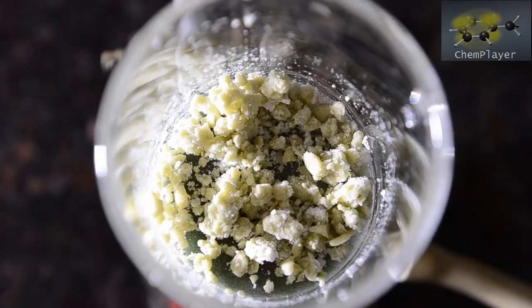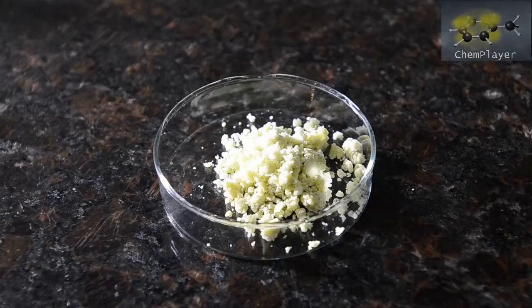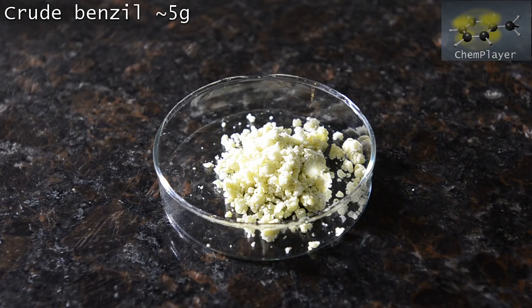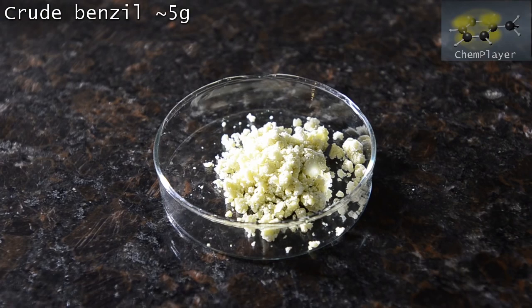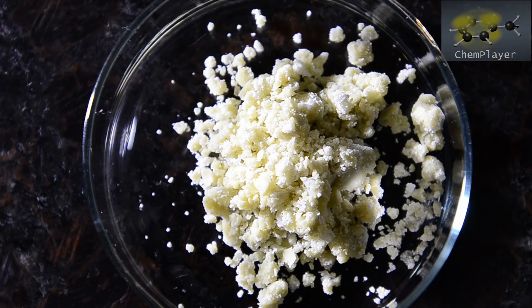We filtered this off and got it dry on the pump. Here's our crude product, about 5 grams of a pale yellow solid material. In the reaction, as the benzil forms, it dissolves some of the benzoin starting material and forms the low melting point mixture, which appears as the separate layer that you saw in the reaction mixture. Because of this, some of the benzoin gets partitioned away from the nitric acid and so doesn't get a chance to react properly. So in this reaction there is always some benzoin starting material present in the product.